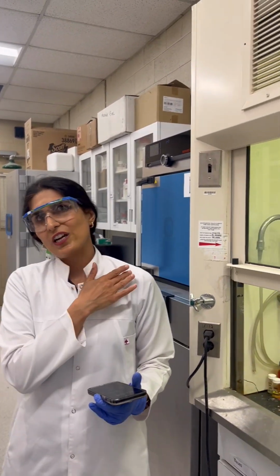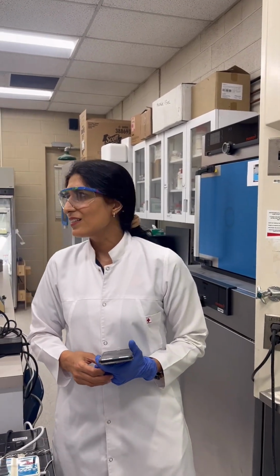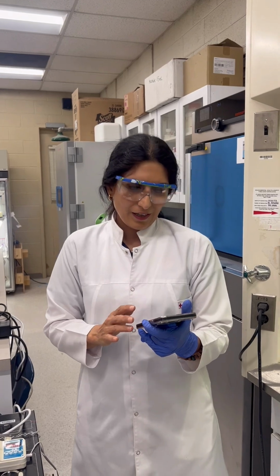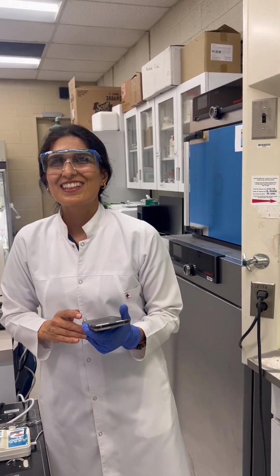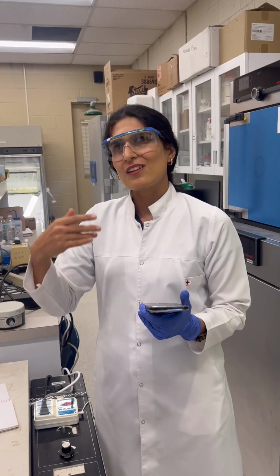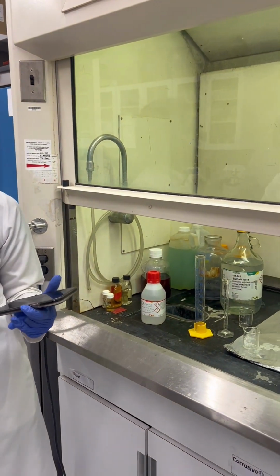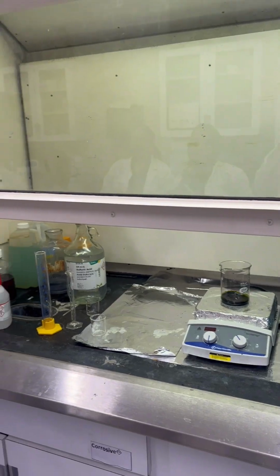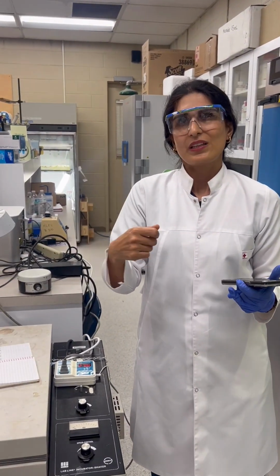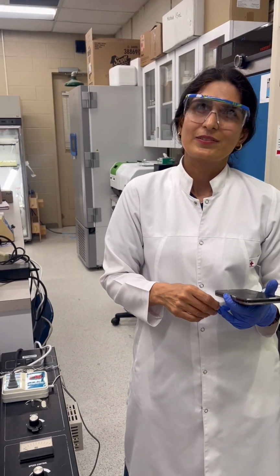And then after that, we put it in to dry. Under what temperature? 90 degrees for 24 hours. Then we crunch it again. I haven't synthesized graphene oxide before, but I feel it depends on the method we use. But for this one, I feel it's a very small amount. It's not that much. But I feel maybe we need to use a mortar more.